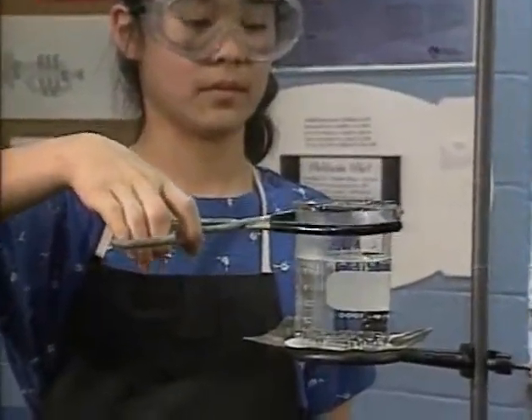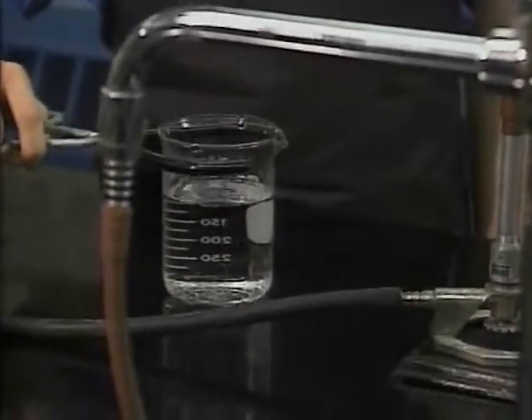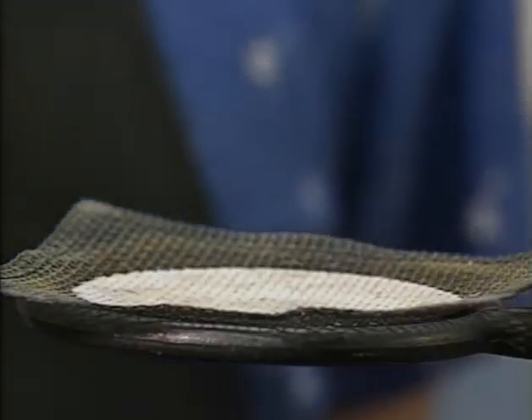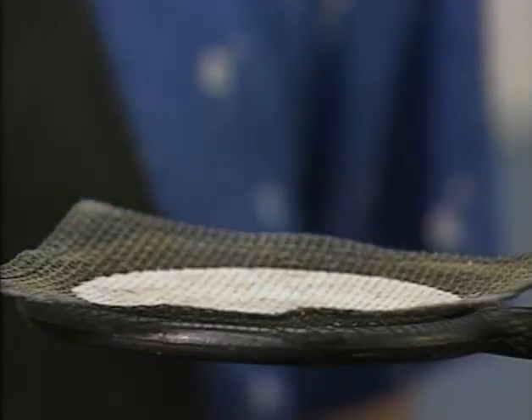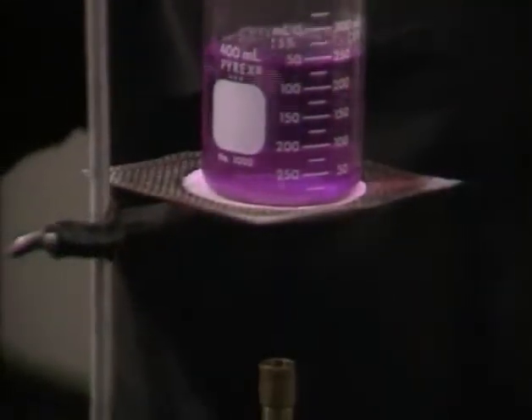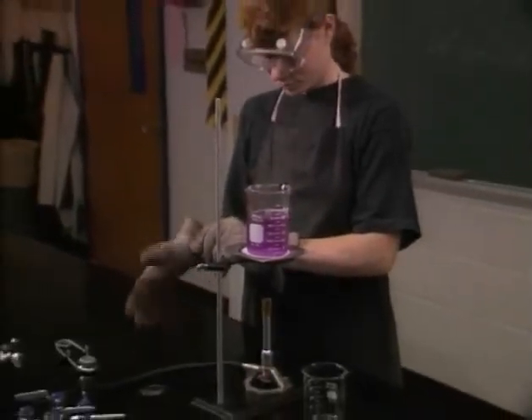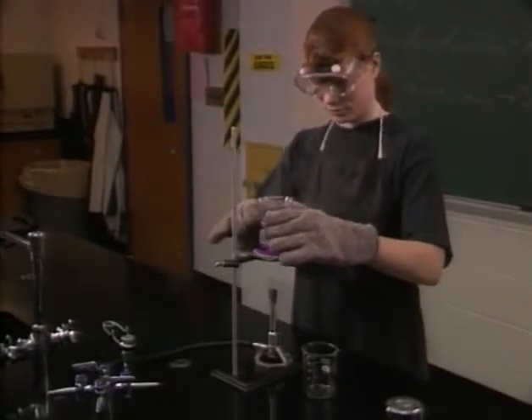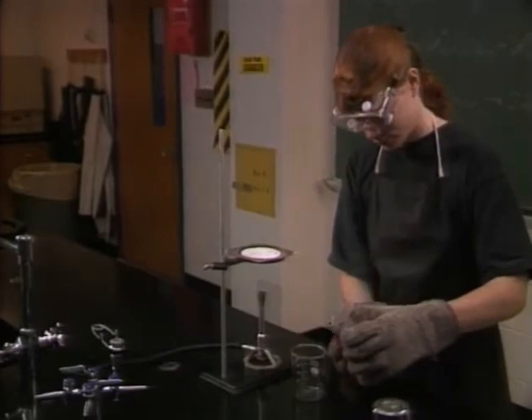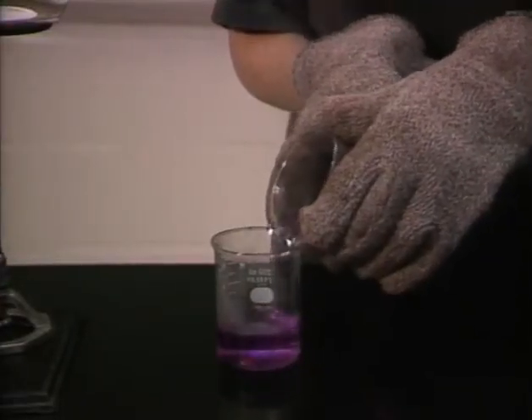Be extra careful when working with heated equipment. Hold hot glassware in beaker tongs, never your hands. Remember that the wire screen and ring stand are also hot. If you don't have tongs, protect your hands with gloves designed for hot glassware. Keep them away from the flame and handle everything as if it's hot — glass and metal look the same when hot as they do when cold.